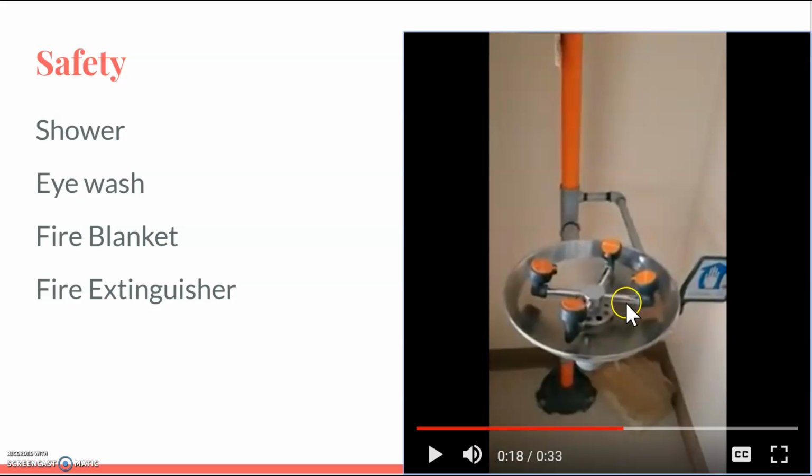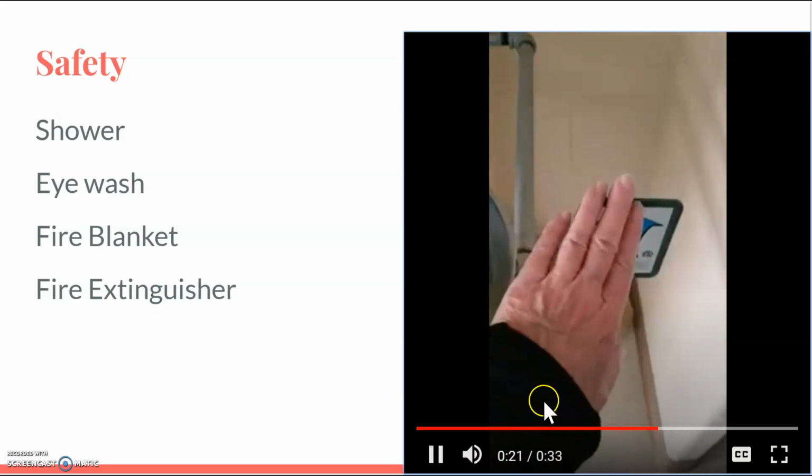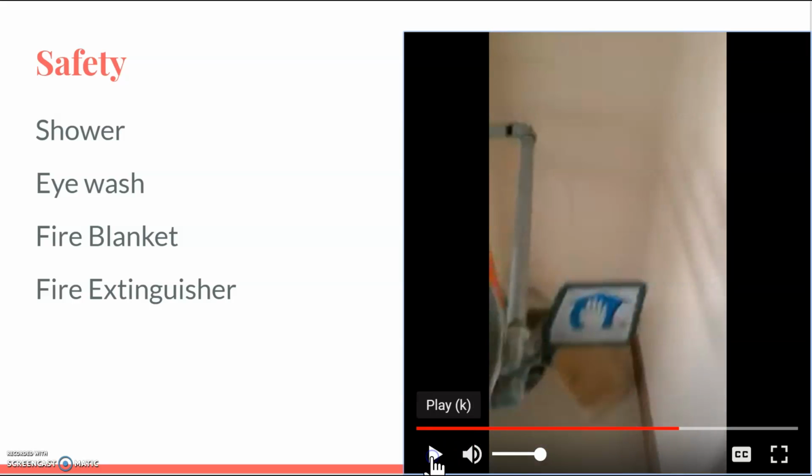You come over here, take off your goggles, you put your head here, and then you're going to push this forward. You're going to push that forward, and water will come out. You keep your head there for a minimum of 15 minutes with your eyes as open as you can possibly, so that you rinse all the chemicals out of your eye.